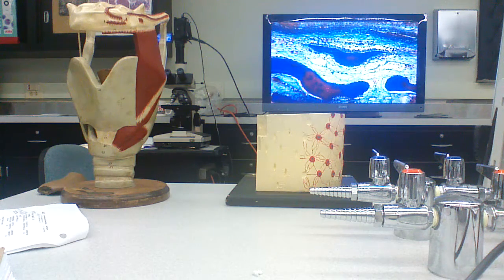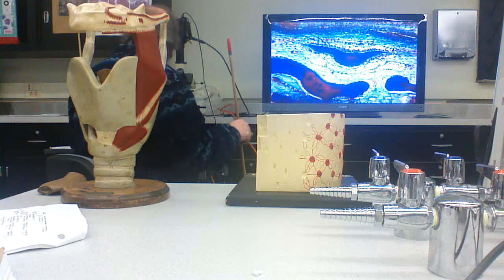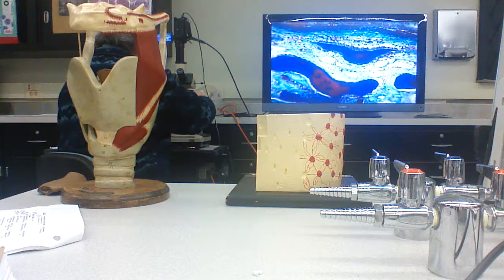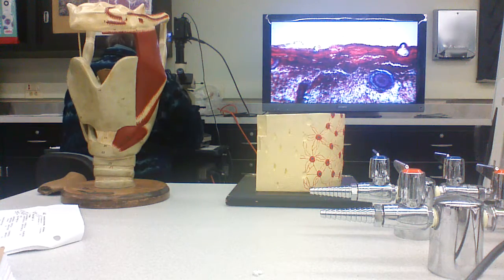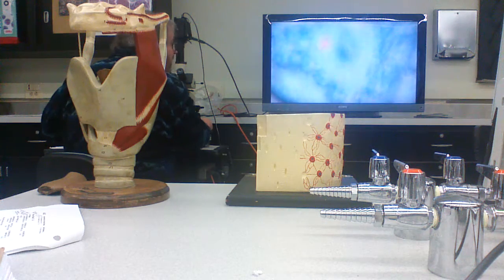And then a network of spongy trabecular bone on the inside. And you may have seen sections through the skull. That's important, because I don't want you to think that you only get compact bone in the bones of the limbs. No, you get it here as well, in the head. You've got several different sections at different developmental stages of intramembranous ossification. And here's another one.